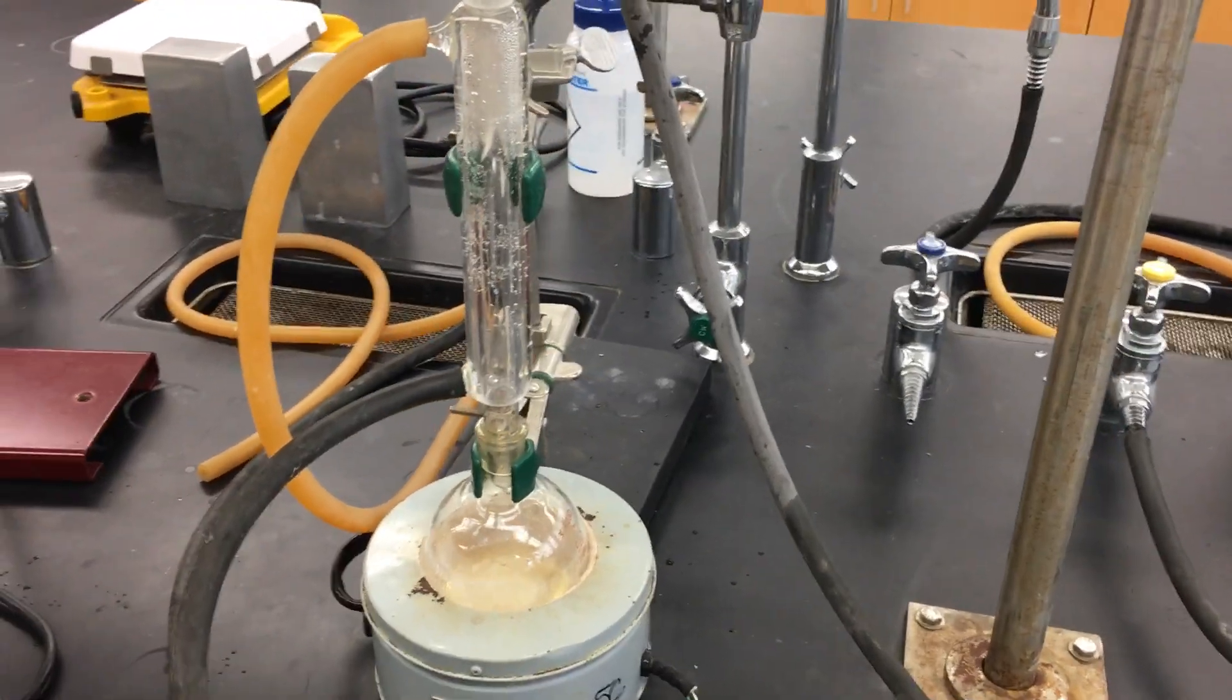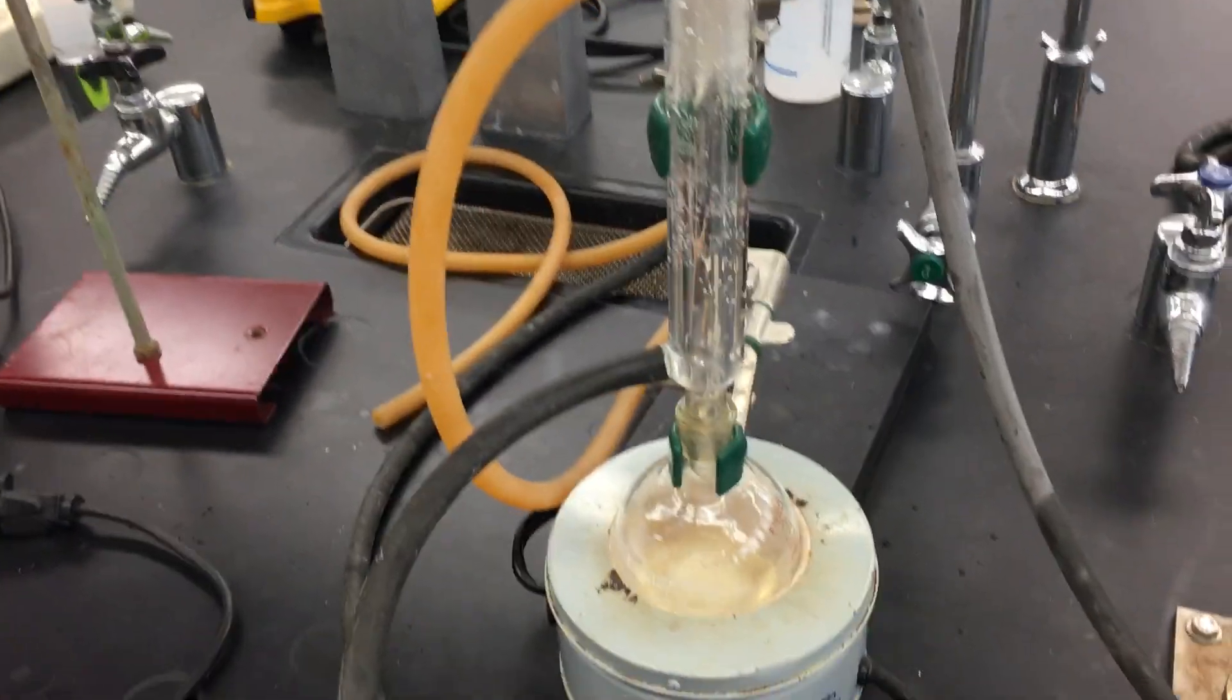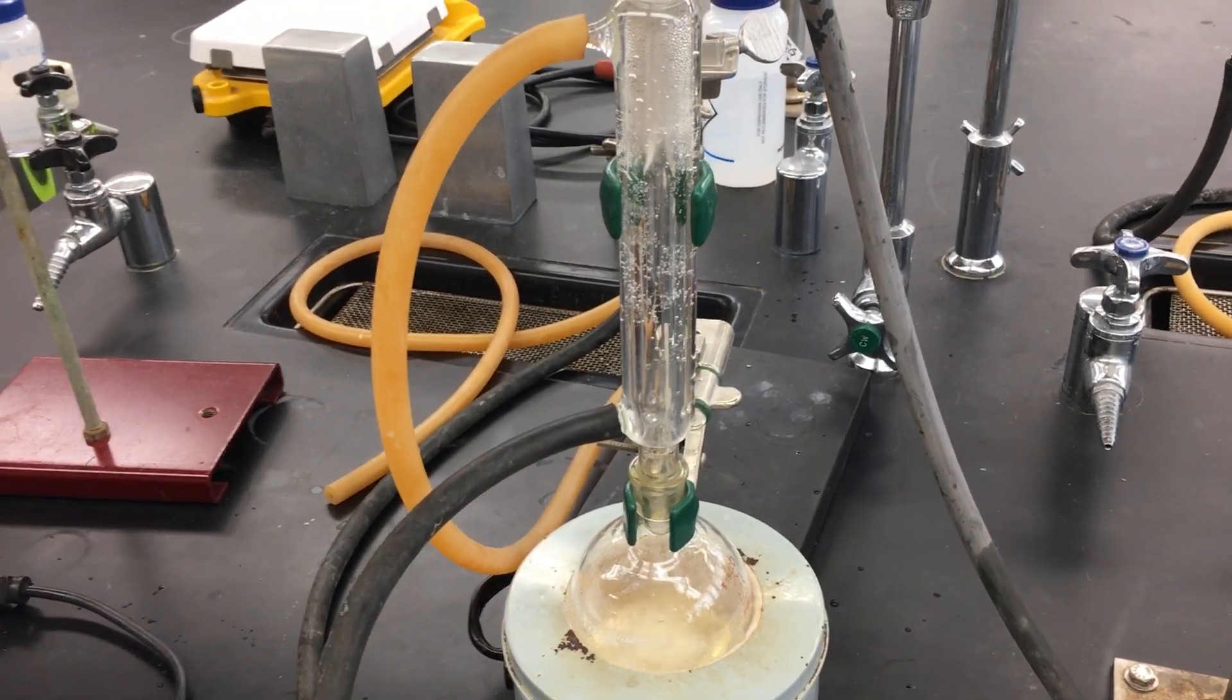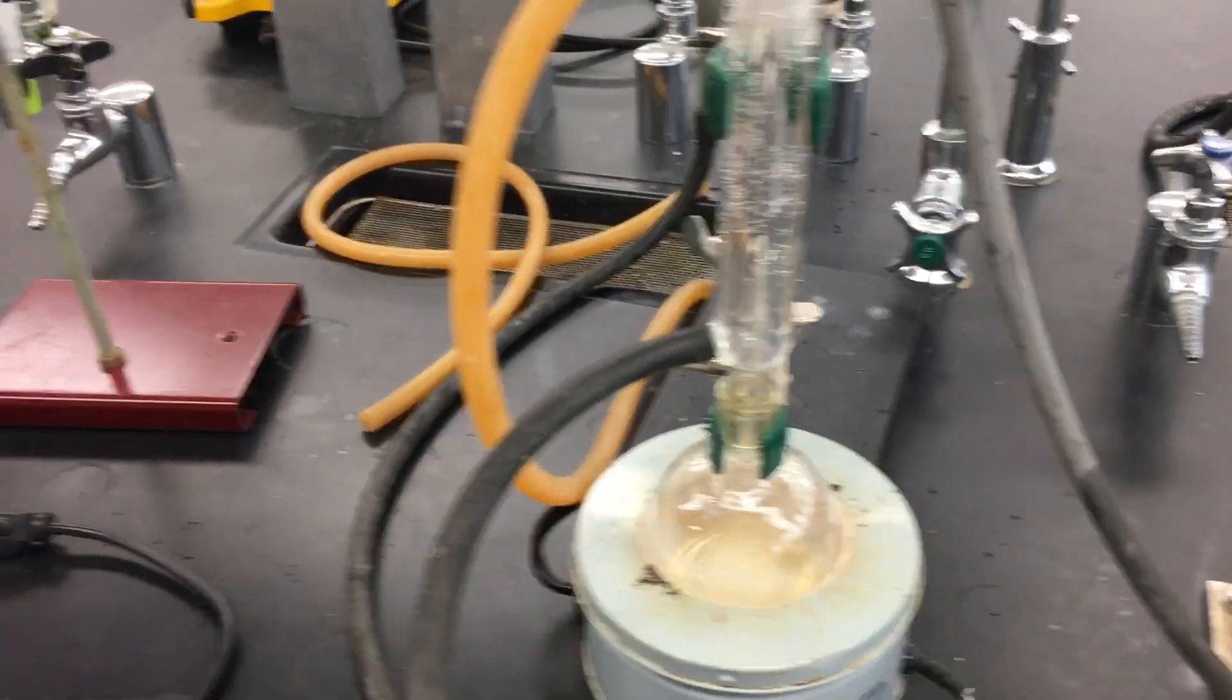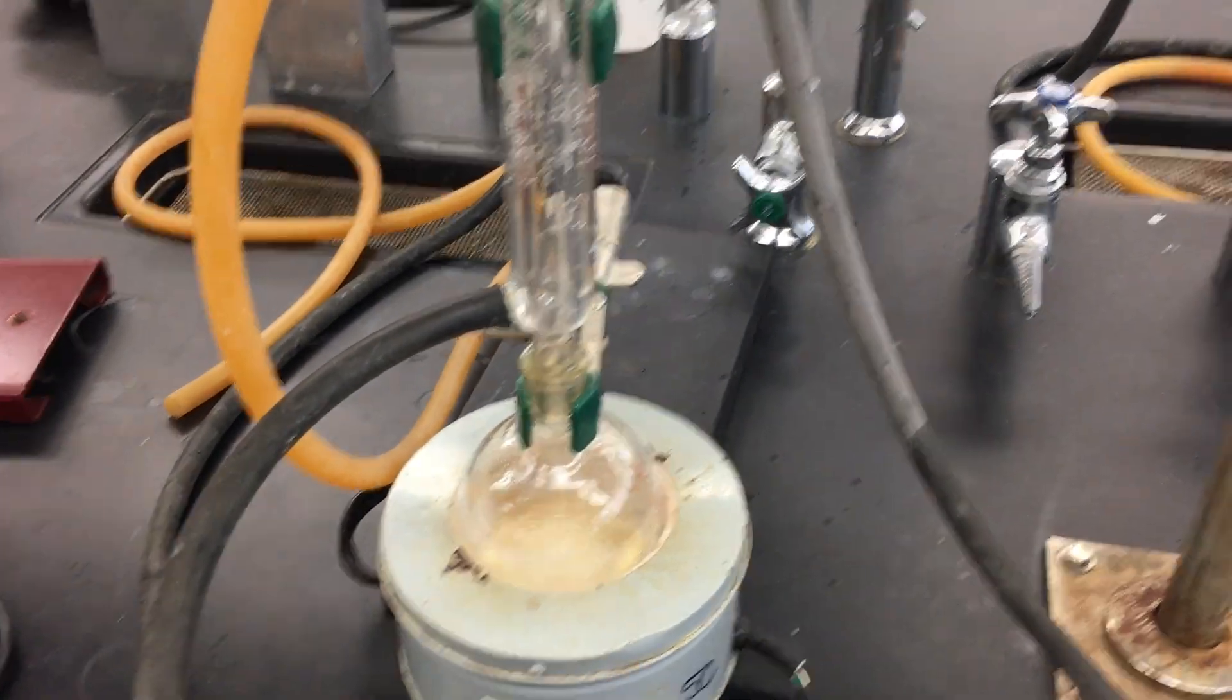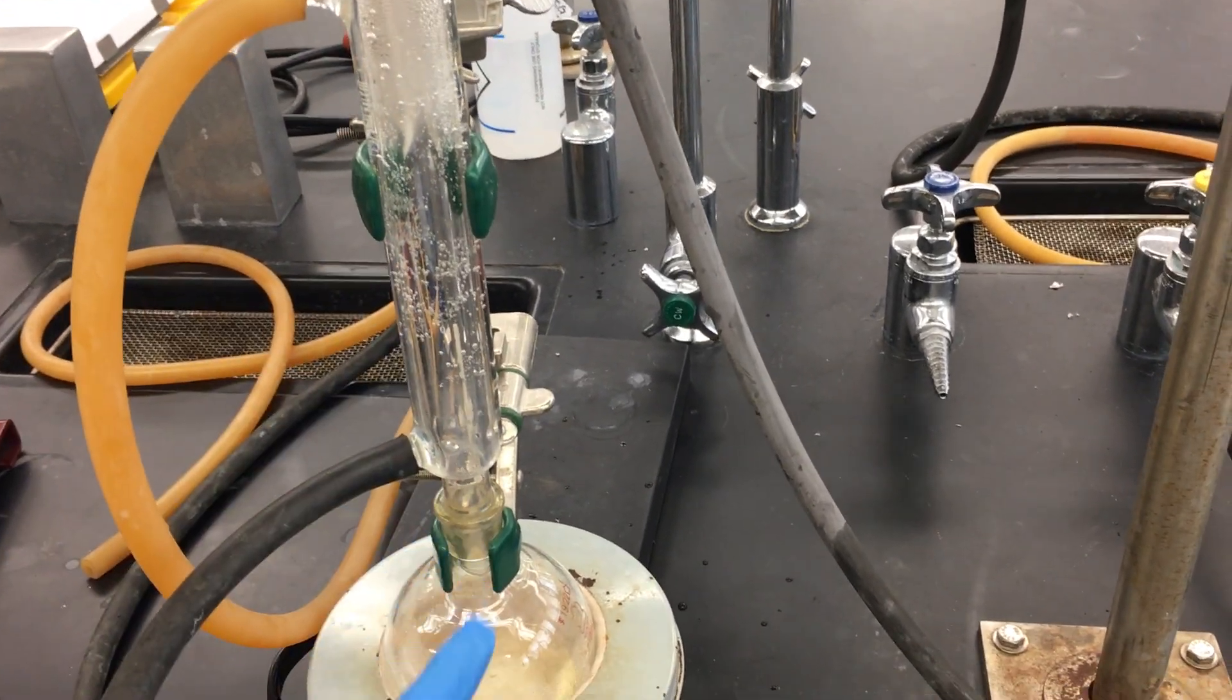With everything assembled back together and adding a glass bead as a boiling chip, we have our reflux going. As you can see, our flask has all of its contents boiling over, and as they boil over they climb up and they drip down.